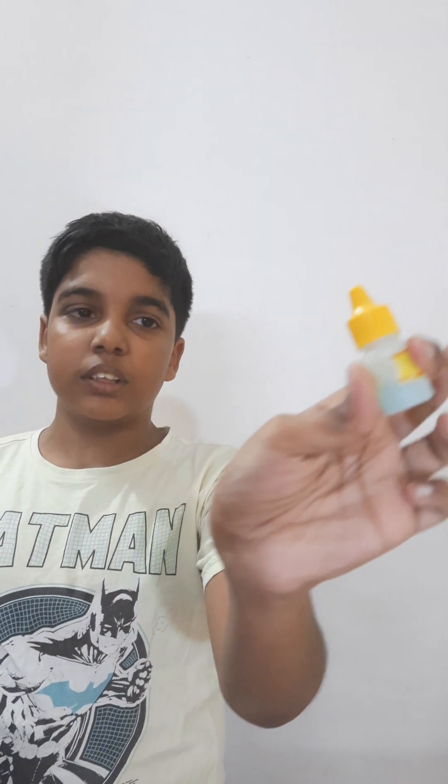Hi guys, sorry to disrupt you — I was cleaning my test tubes. Today we are going to perform a very intricate and interesting experiment where you can see how chemical reactions happen between two chemicals and form new chemicals. For this, you need only one chemical to start: copper sulfate. So let me introduce our chemical — this is copper sulfate.